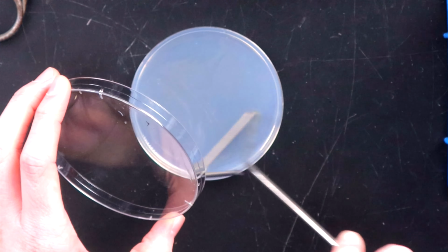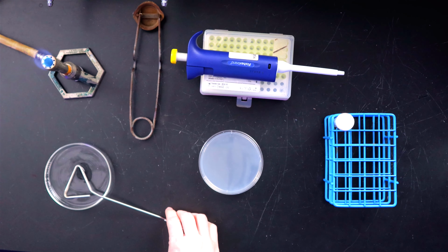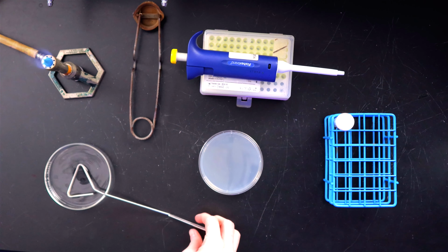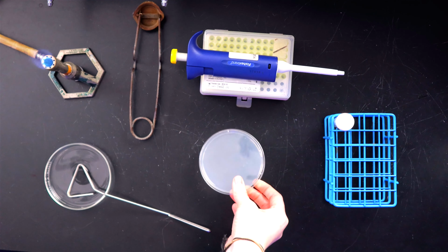So basically this bougie confabulator, the spreader, is just spreading that little amount of liquid you put on there all over the plate, so the bacteria can see all of the media on the plate. Right. And then of course we put our lid back onto the plate and our spreader back in the alcohol. You won't see the bacteria after you spread it. Why not? Because the bacteria is so small that you can't see it on the plate. Exactly. But as the bacteria is on the plate, it's going to absorb those nutrients, and they're going to grow and grow and grow.